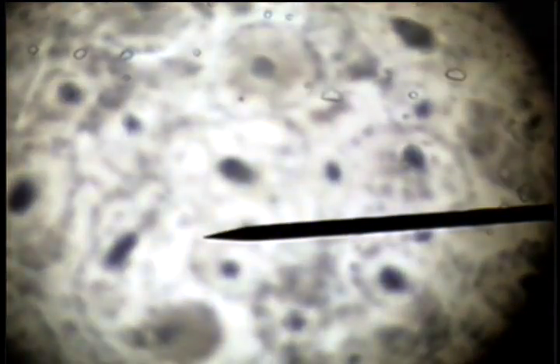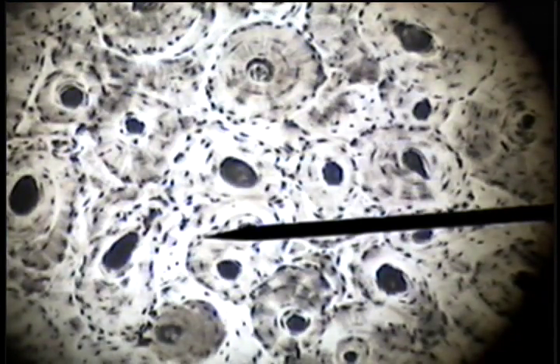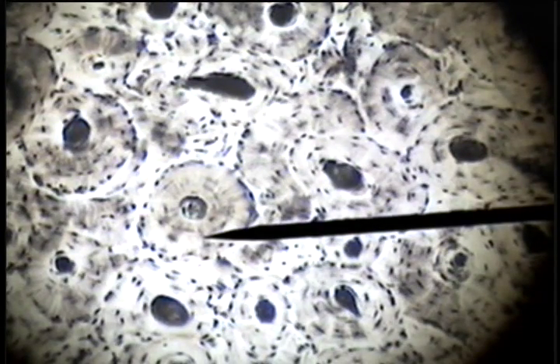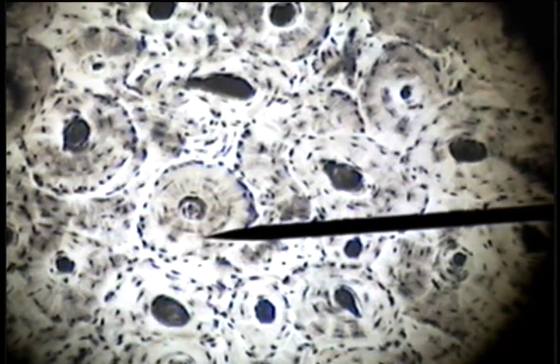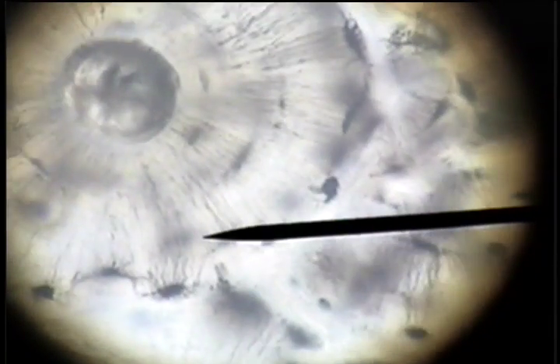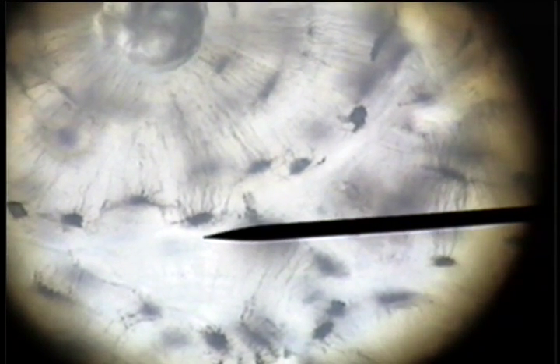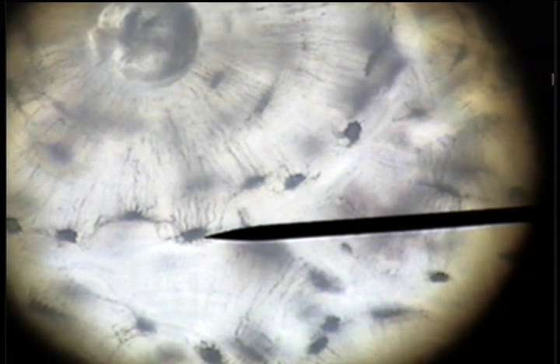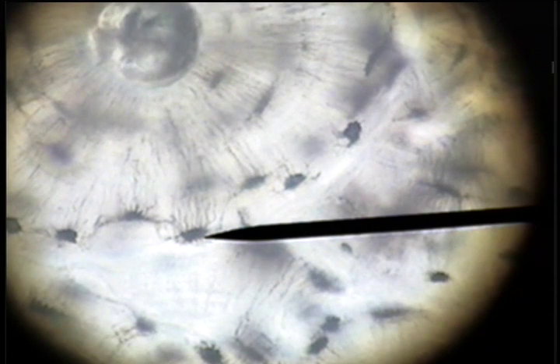If we go to a higher power we see that there are circles or lamellae of bone tissue surrounding the Haversian Canal in the center. And each of these rings of bone has an osteocyte in the lacuna. In this case the lacuna is filled with the grinding material and the cell would occupy this space, the lacuna, and that would be the osteocyte.